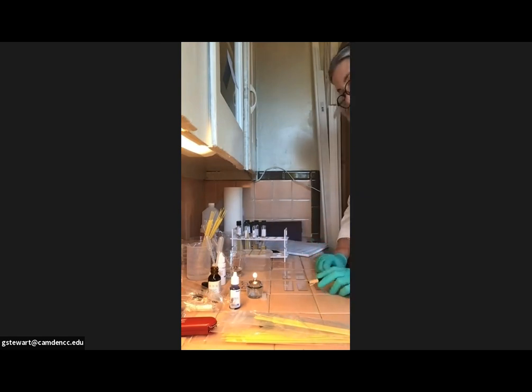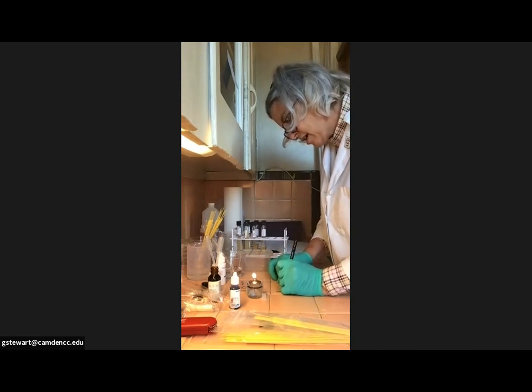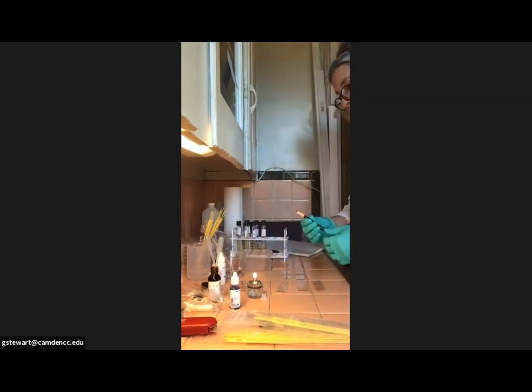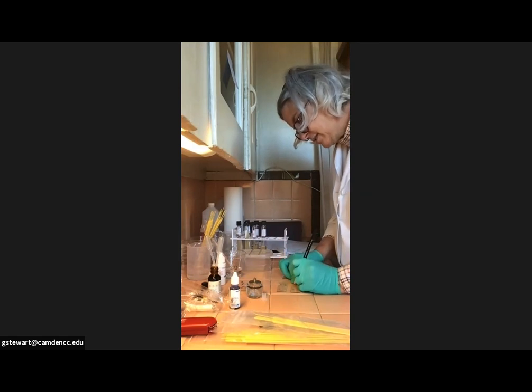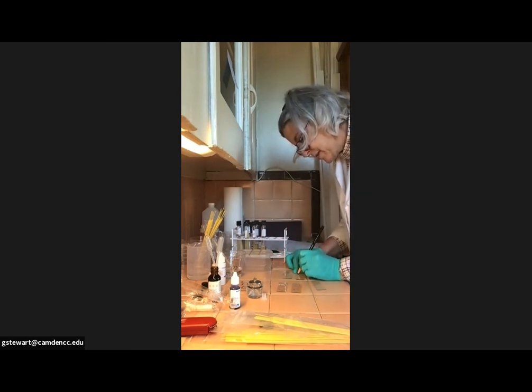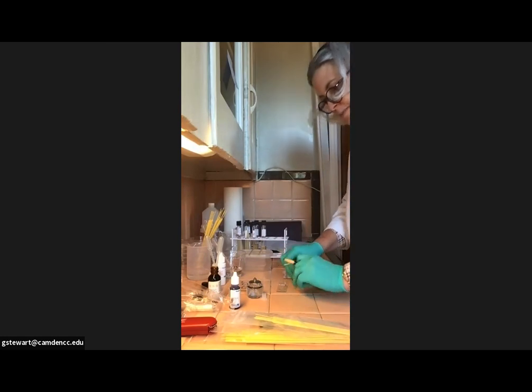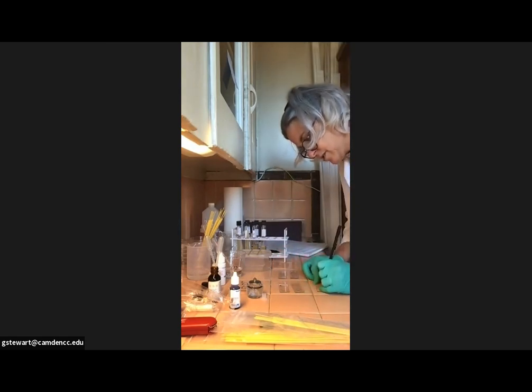I would advise to use the crayon for these slides. And the reason for that is because the alcohol in the decolorizing step will remove the Sharpie. Now, in lab, we normally tell students you're going to put 2 circles on each of these slides, except for number 5, because that one you're just going to have a single smear. And then we usually indicate to students it's best if you actually flip the slides over and put your bacteria in those and use them just as target circles.